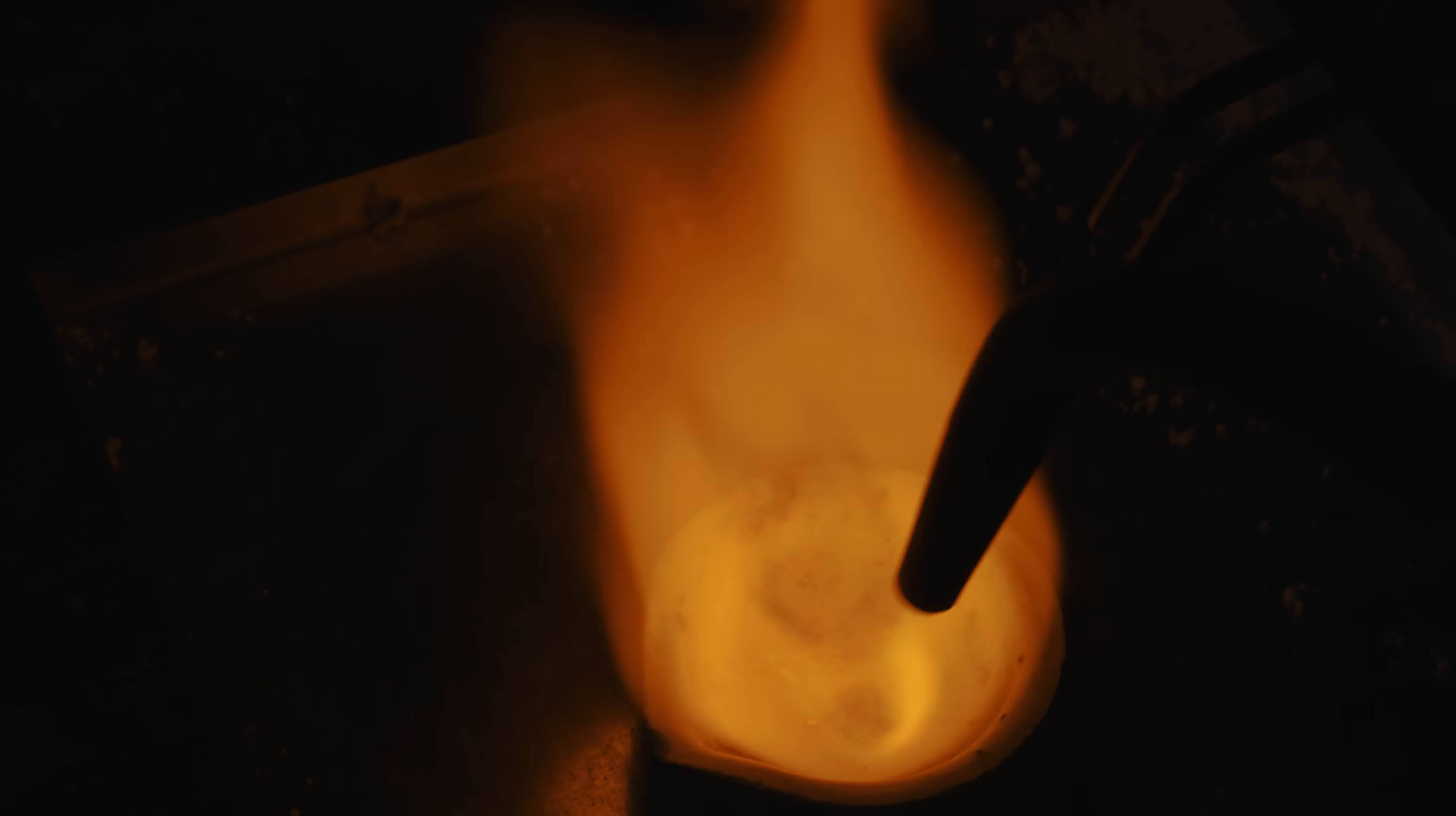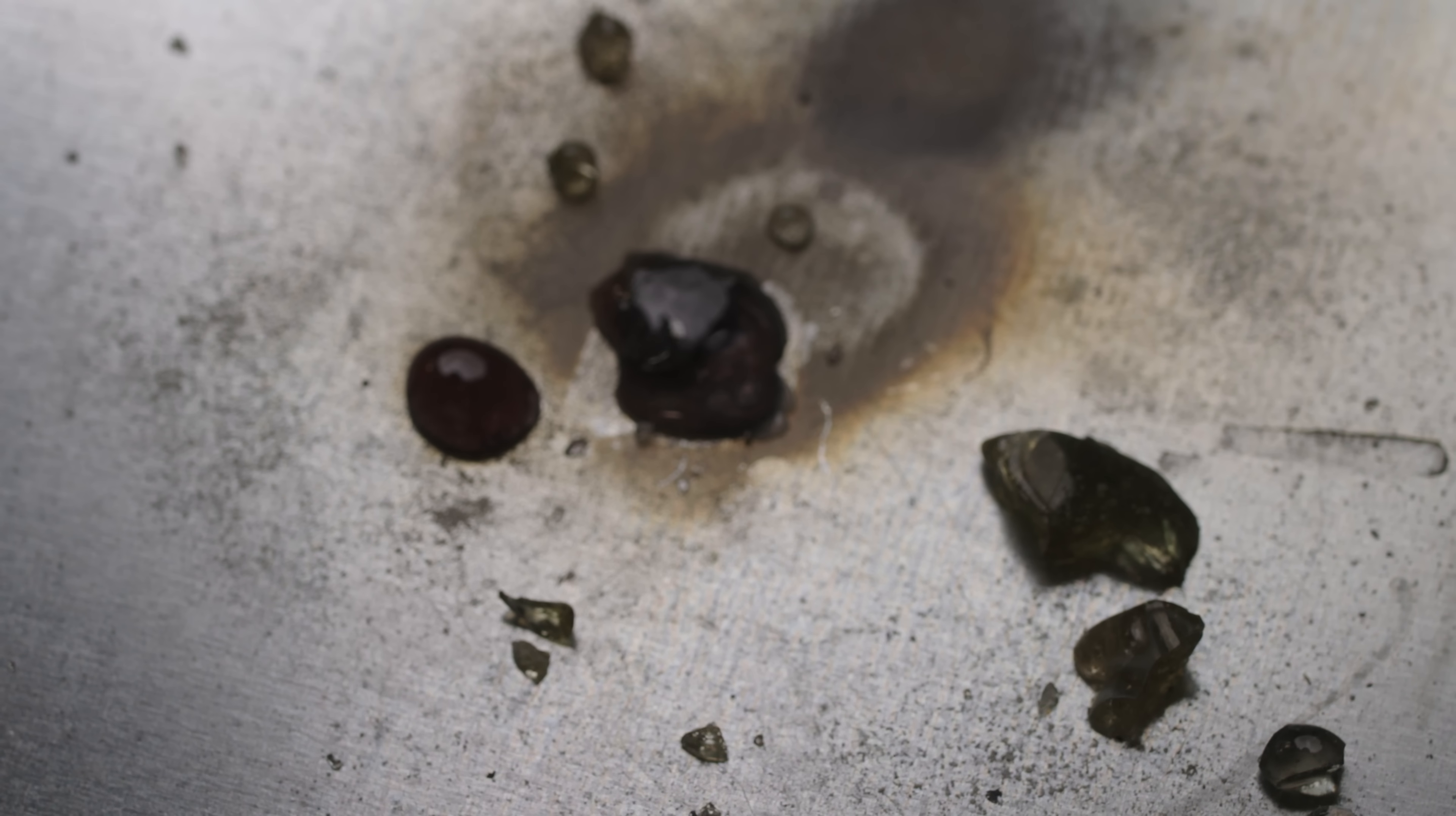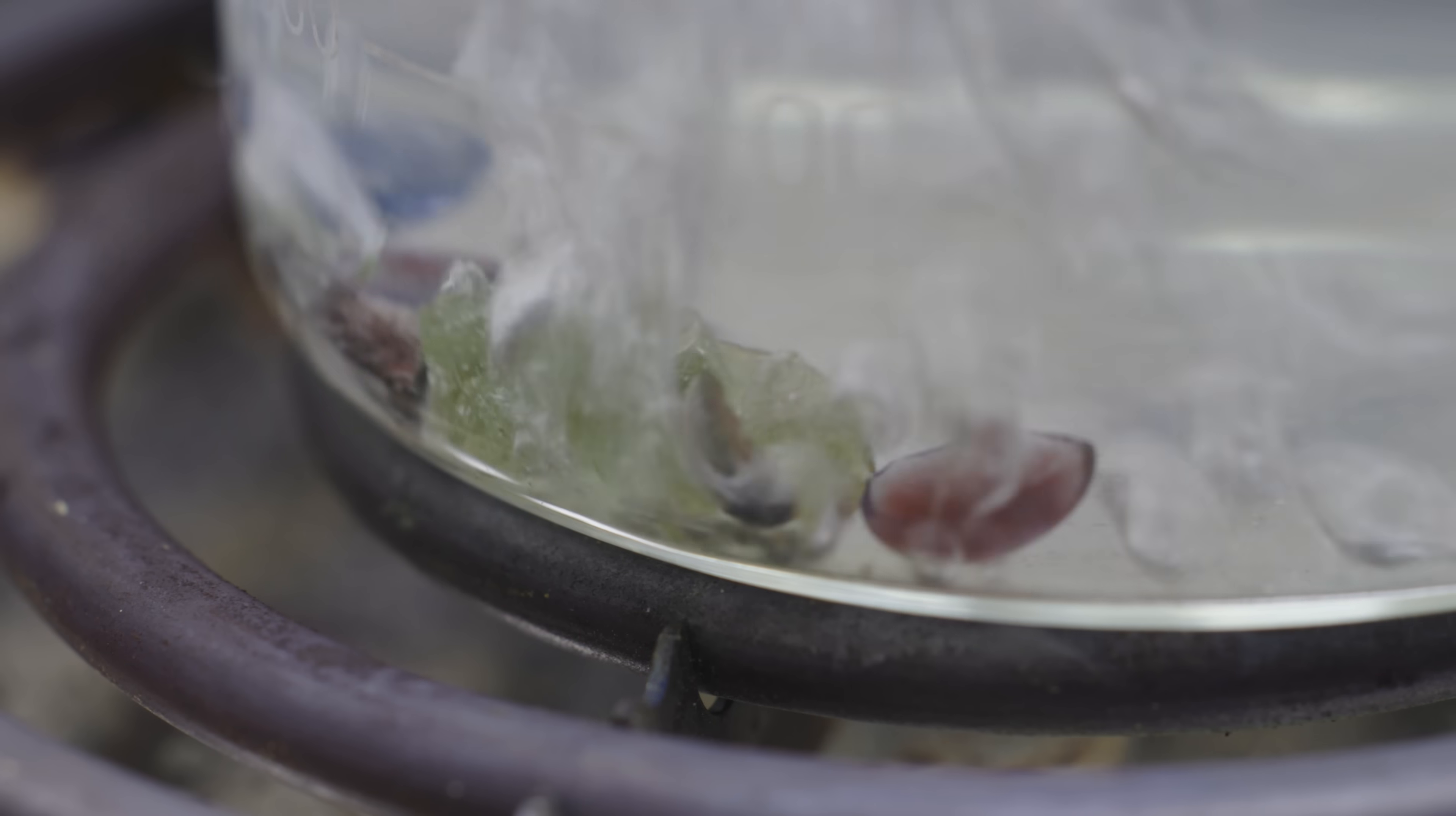I'm just going to try to pour out what I can. All right, so I just poured a couple of beads and they look really cool. Like these little borax beads look really beautiful. And at this point, I just need to dissolve it and break it up as much as I can to see what sort of metal is inside of it. Is there going to be any gold at all? Now borax is water soluble. So with enough time, this should start to break down, leaving behind hopefully some precious gold.